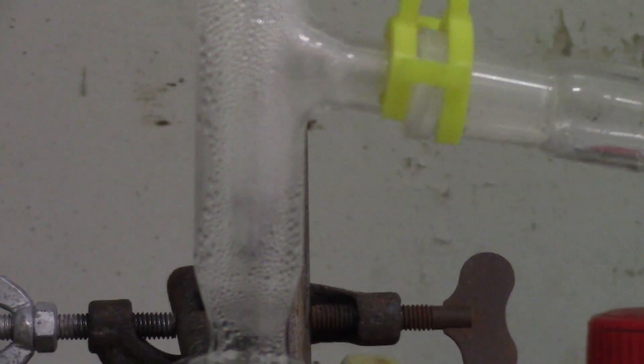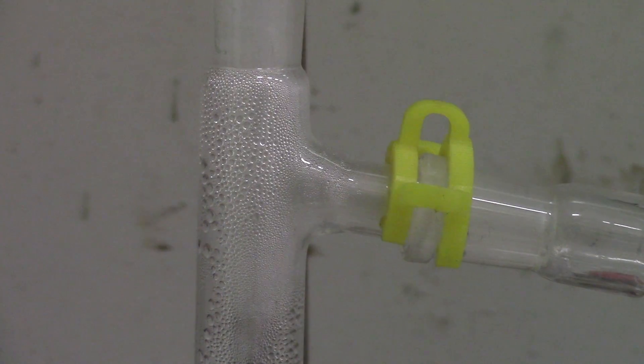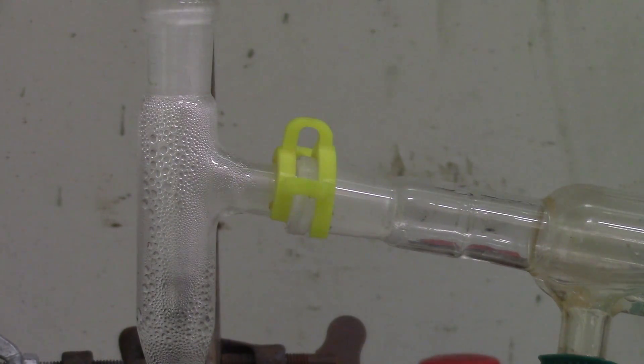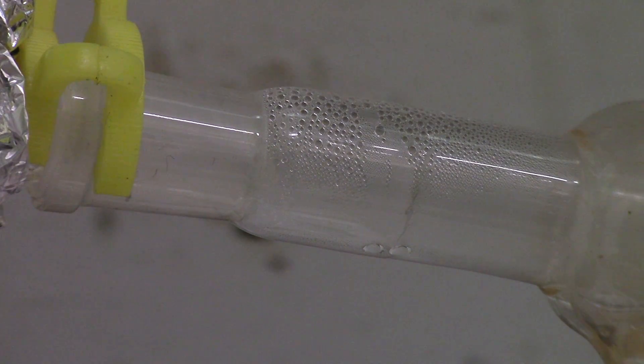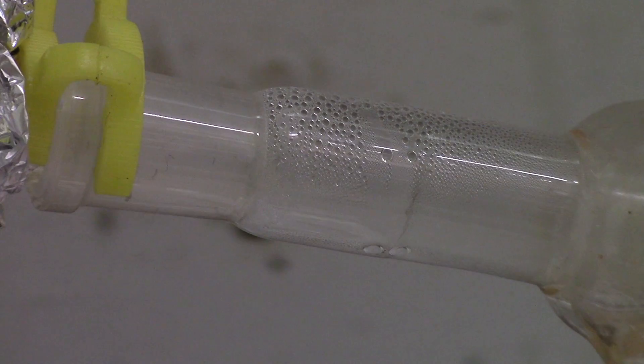Also, the three-way adapter is wet now. The first drop is obtained at 180 degrees C. Of course, it's vapor temperature.